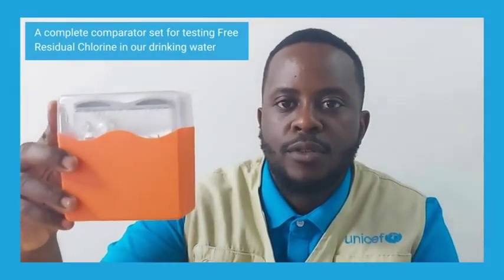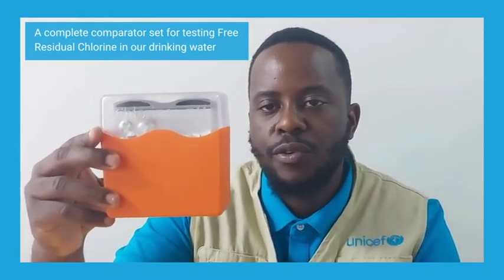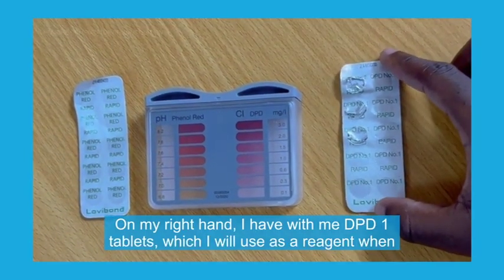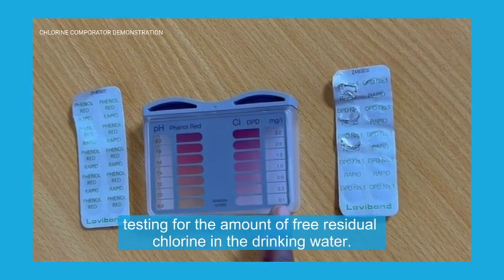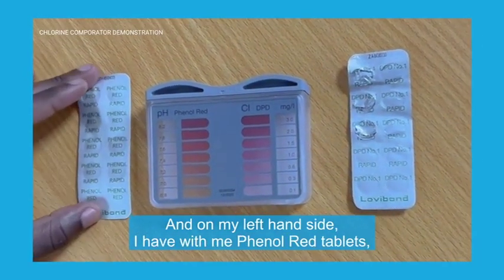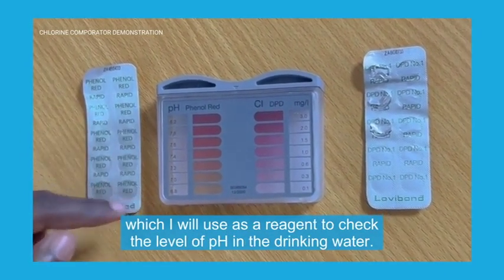I have here a pool tester, also known as a comparator, which is used to measure the amount of chlorine residue in our drinking water. On my right hand I have DPD1 tablets which I use as a reagent when testing for chlorine residue, and on my left hand side I have phenol red tablets which I use as a reagent to check the pH level in the drinking water.